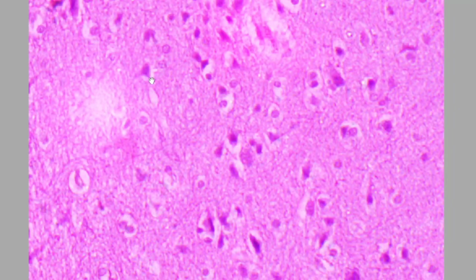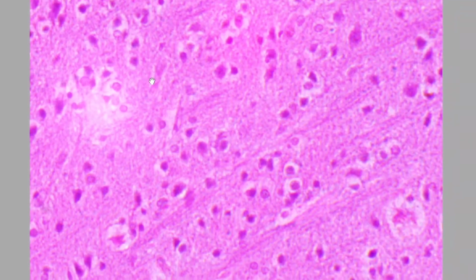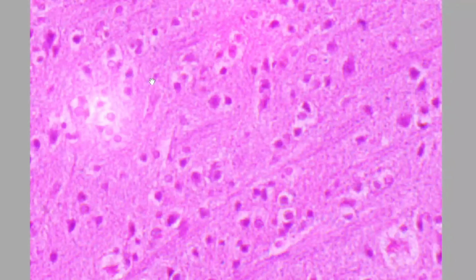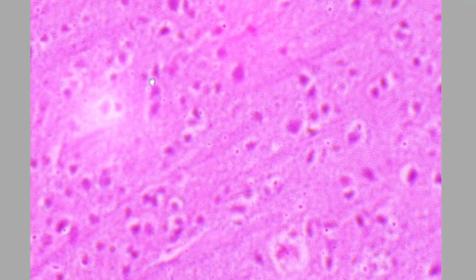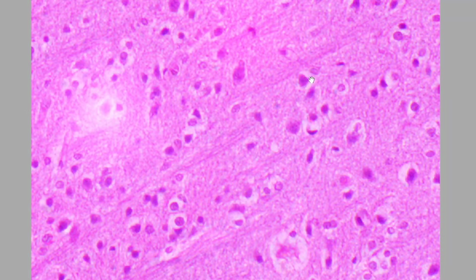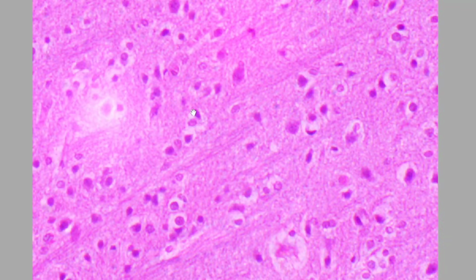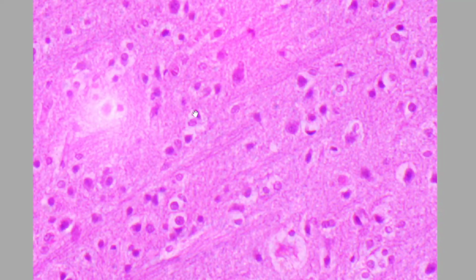So these all are the multipolar neurons. If you focus at different places, here also you will find that the outer border of the cells are not round. Most of the cells are showing some kind of triangles, or you will find some projection or angles. Now suppose I see this slide. Here you can see this cell. Now this tip is showing the sharp point. So you have to find out these points or the projections, and these projections are the feature of the multipolar neuron. Here also you can see the cell. The cell is also having the triangular shaped body.